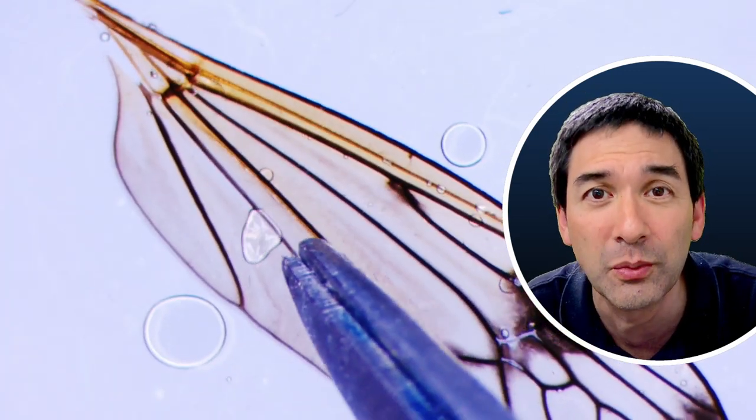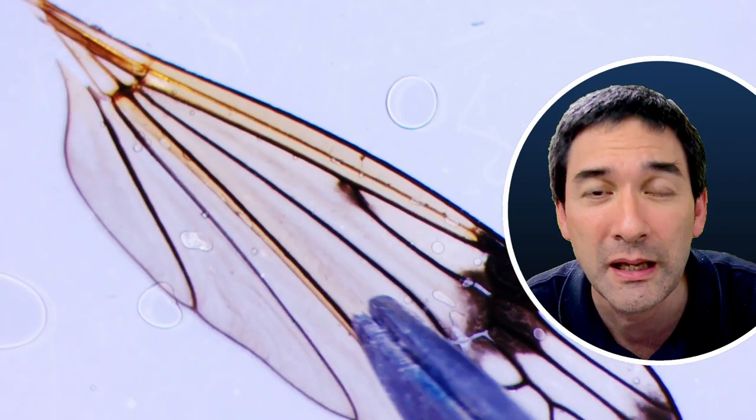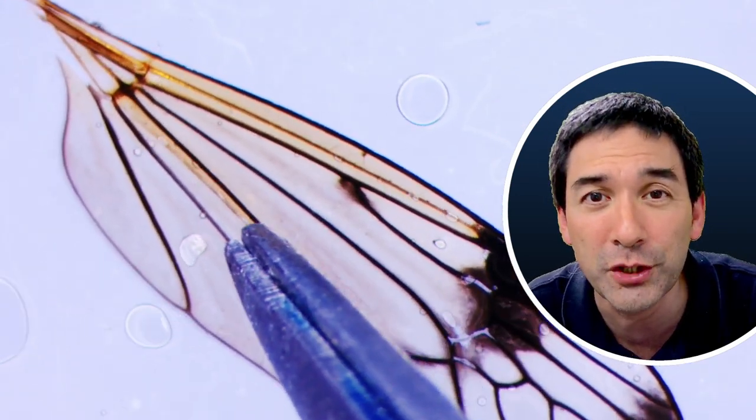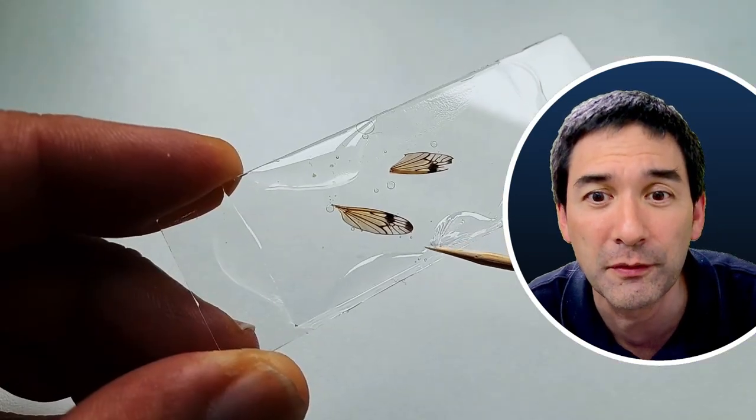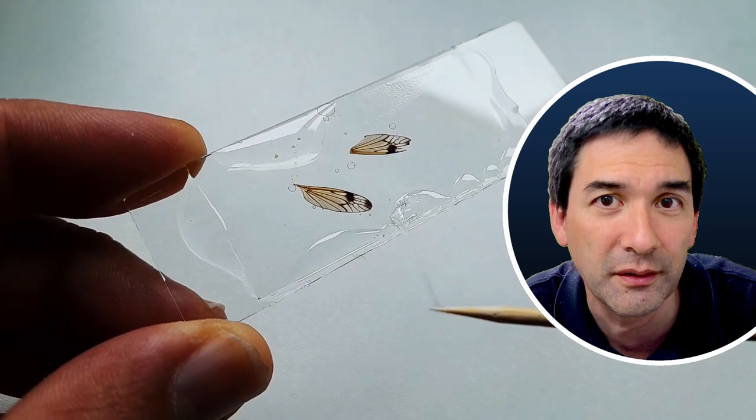You can see that the air bubbles are allowed to escape this way, but of course by applying quite a bit of pressure what also happens is that you're squeezing out quite a bit of the glue from under the cover glass.